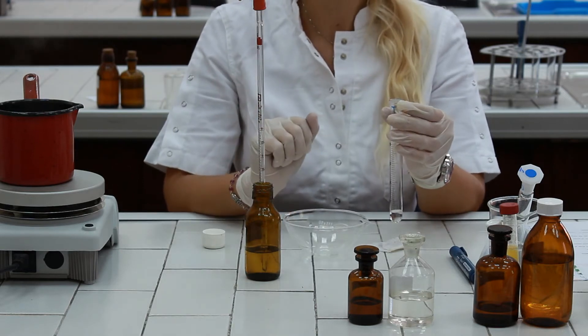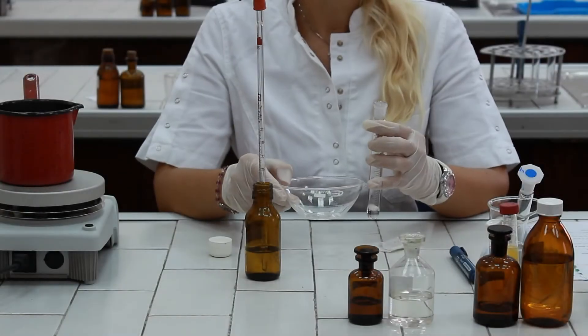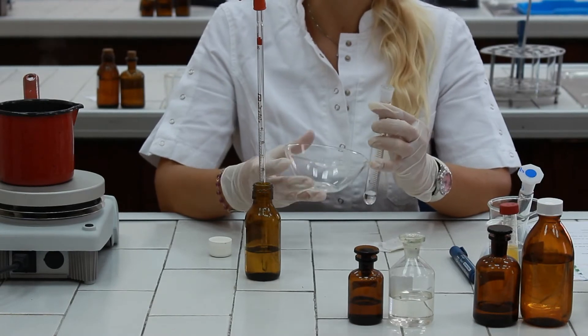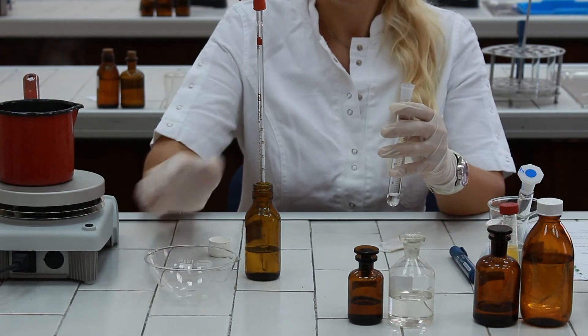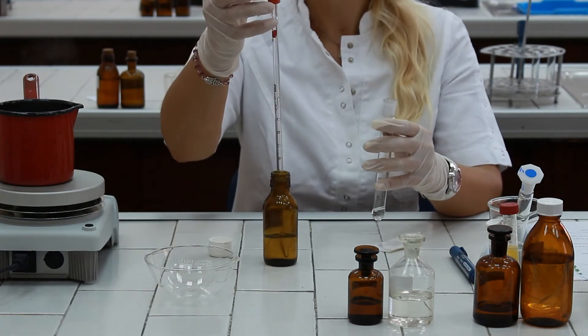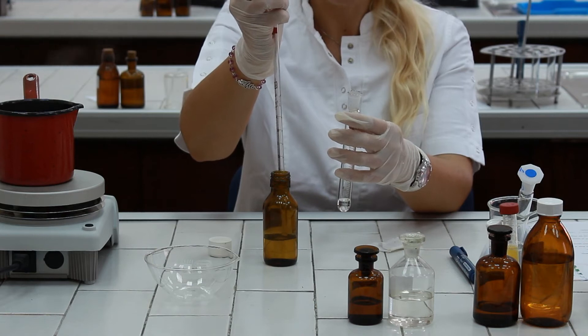Repeat the procedure two more times. After the transfer of cholesterol from evaporating dish to graduated cylinder, we have to fill the cylinder to the graduation mark of 8.